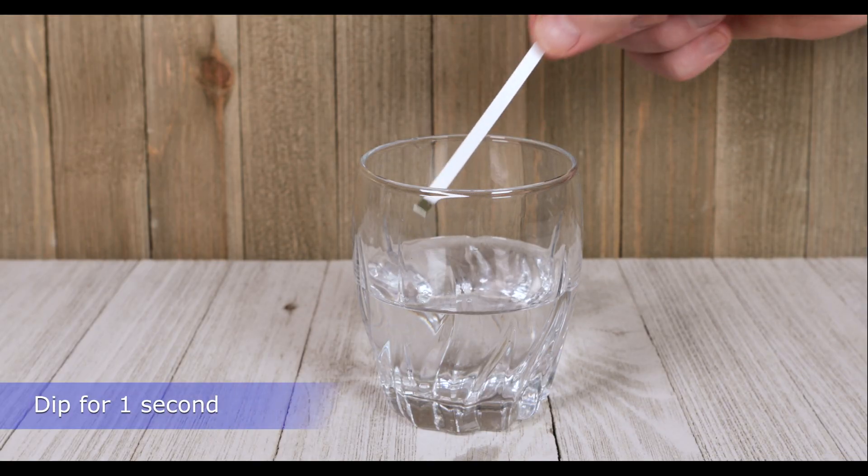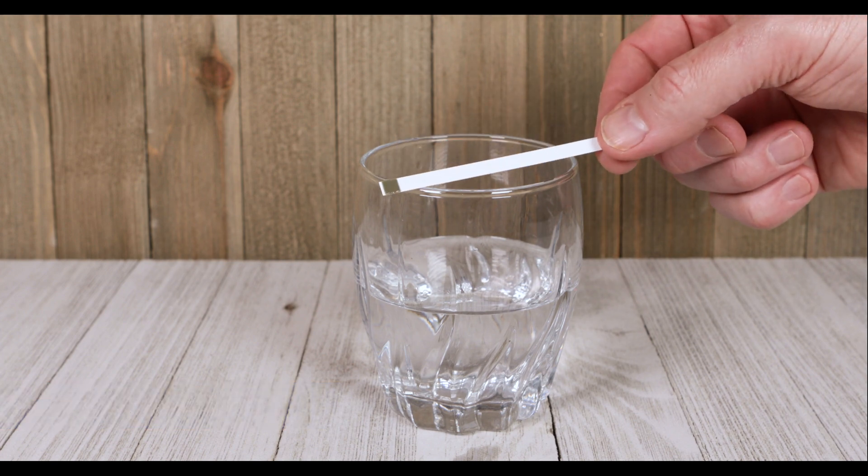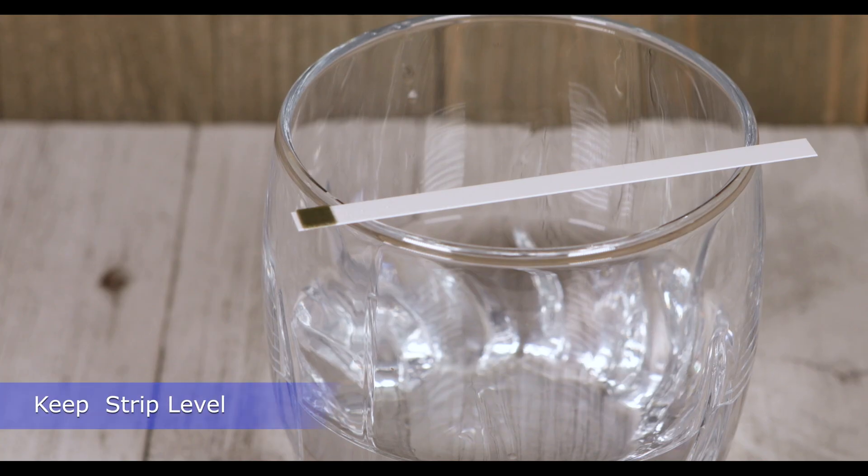To test, dip the strip for one second and shake off excess water. Hold the strip level pad side up.